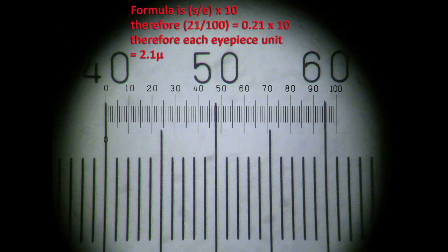Now you can check this pair of values by thinking about the change in magnification factors involved. By going from the 10x to the 40x objective, although you are magnifying the image by a factor of 4, you are essentially decreasing the field of view by the same factor of 4.